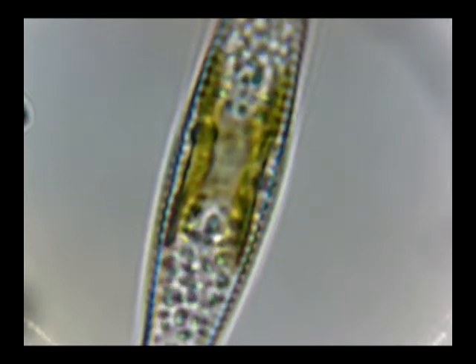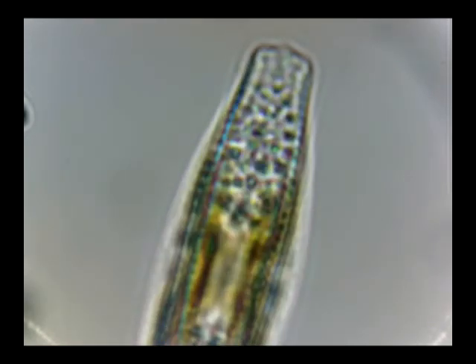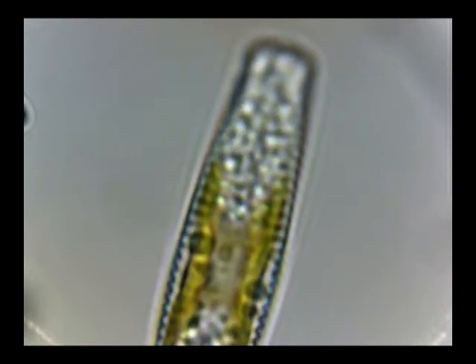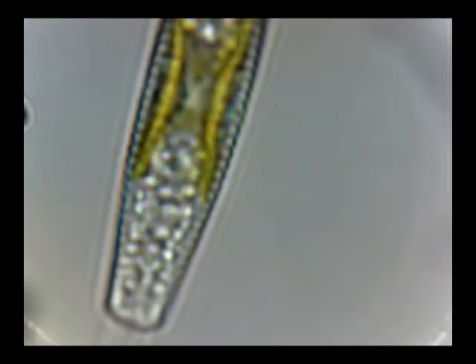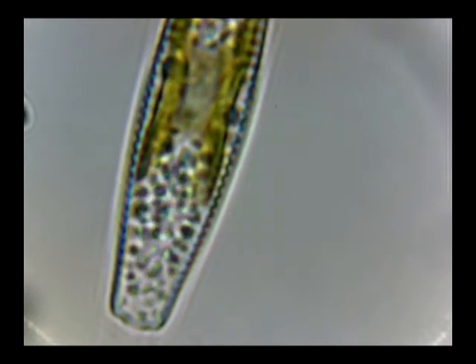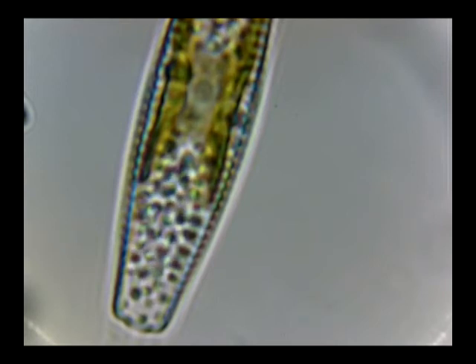Let me adjust the condenser — and there we go. Damn, that's what oil immersion is all about: extreme quality of image not achievable by conventional means. Only oil immersion optics can do this well with regular lenses. Beyond that you have to get into electron microscopy. This is as good as it ever gets optically. Not bad at all.